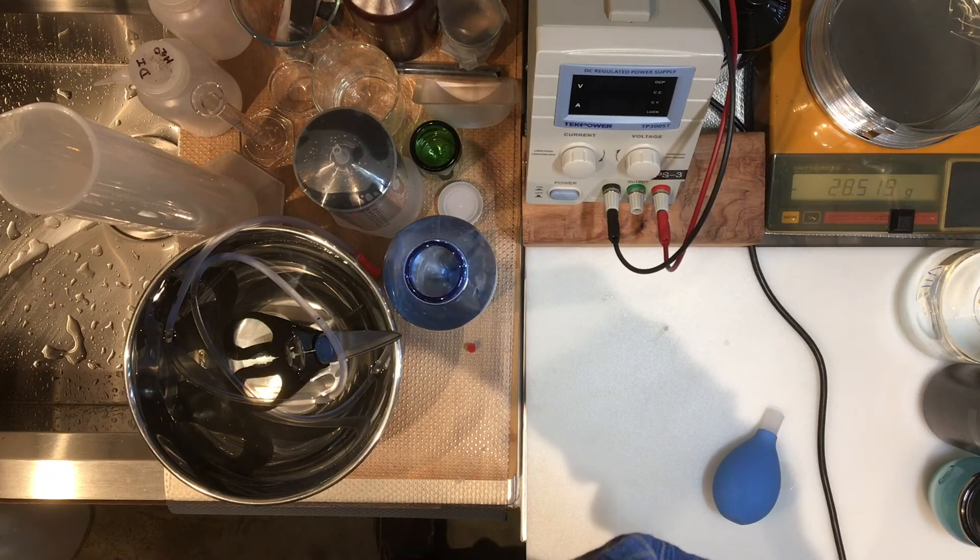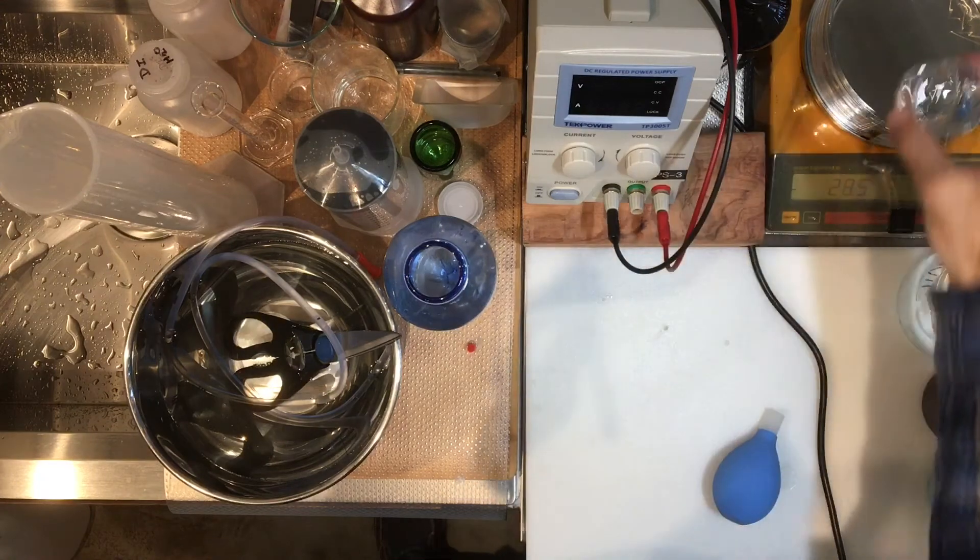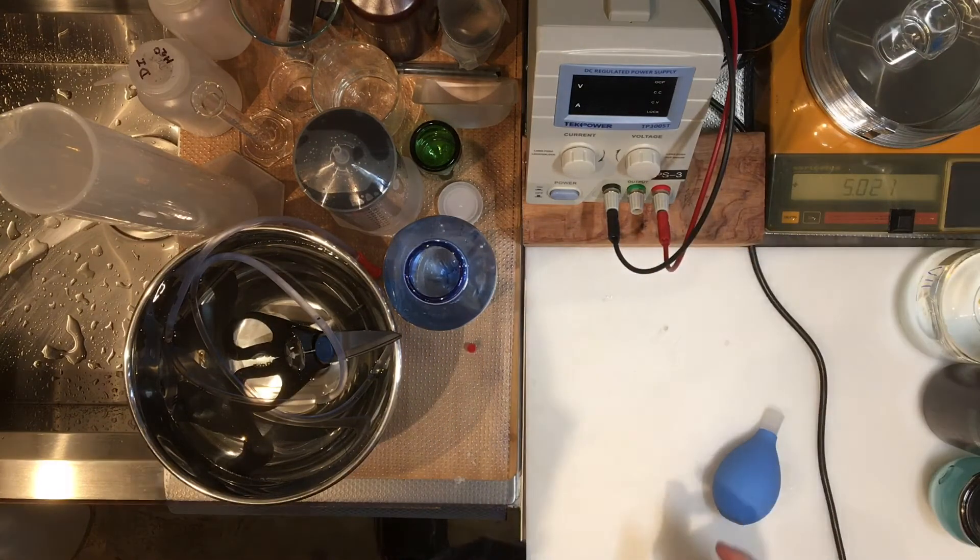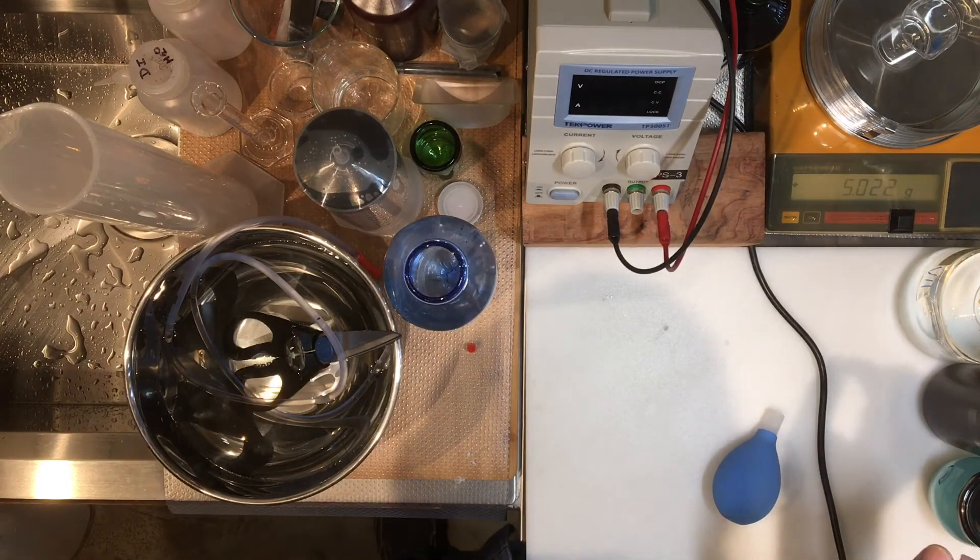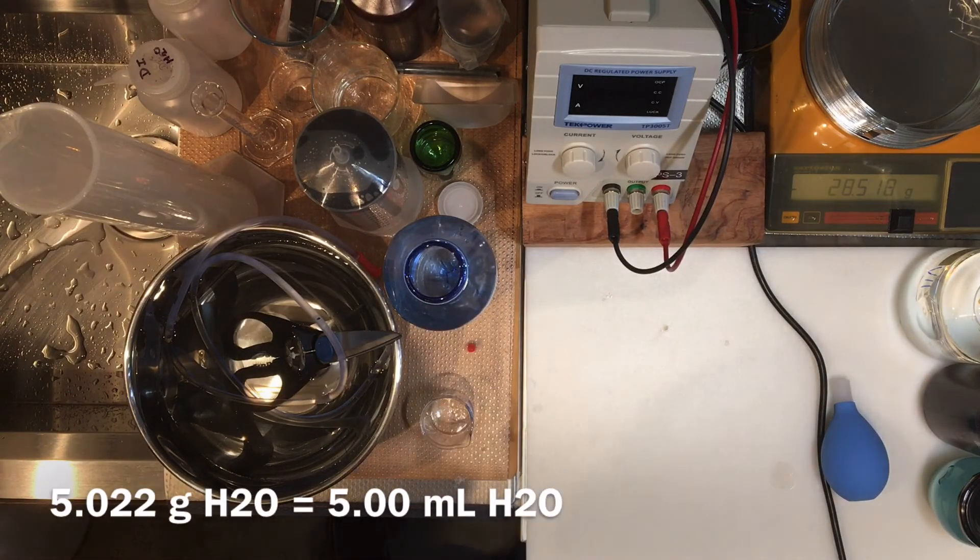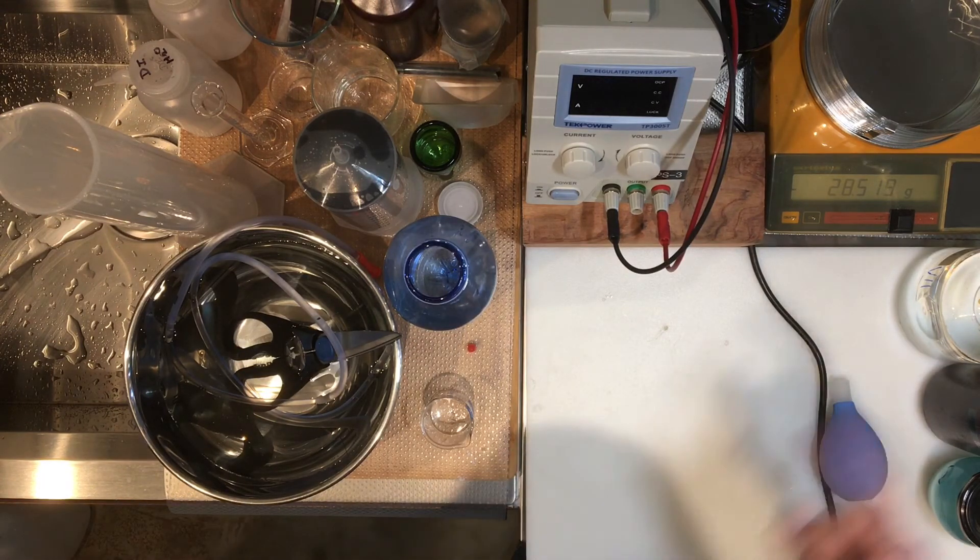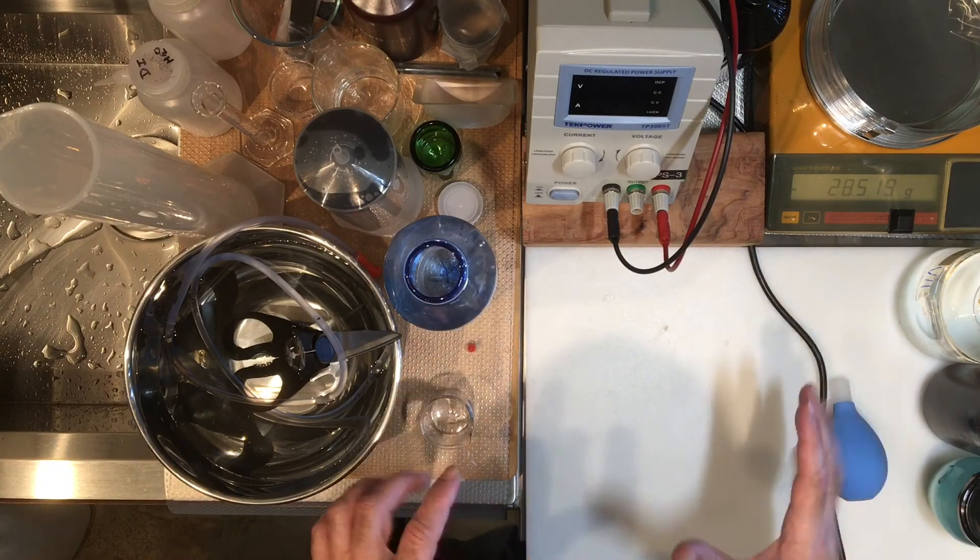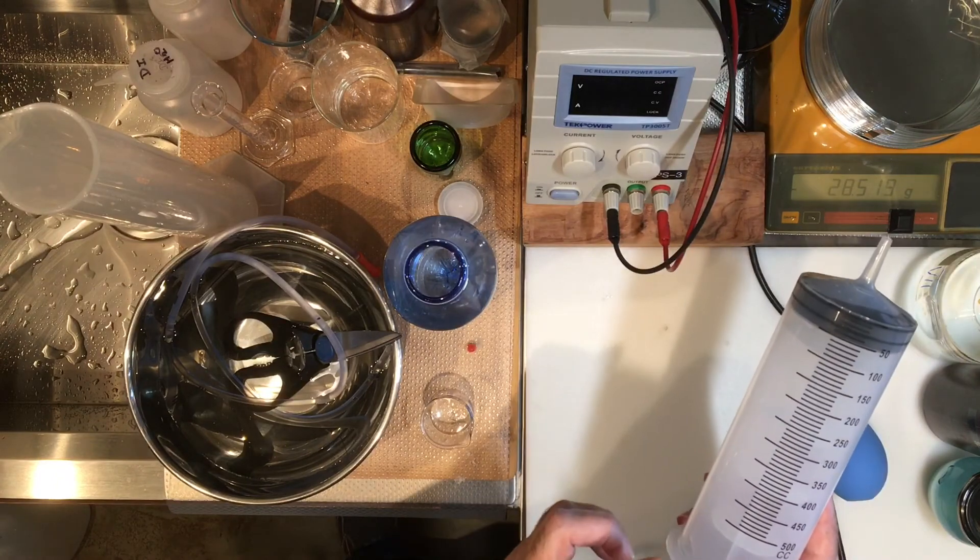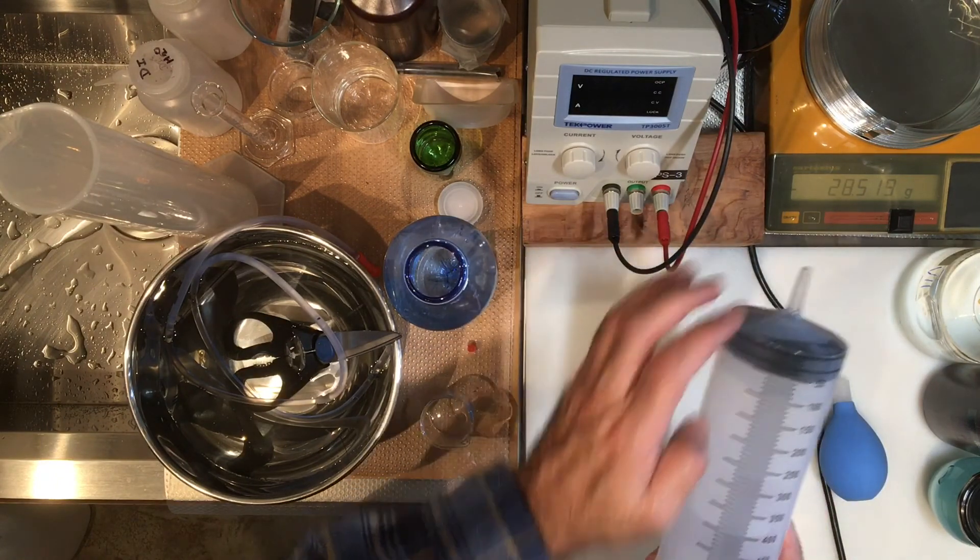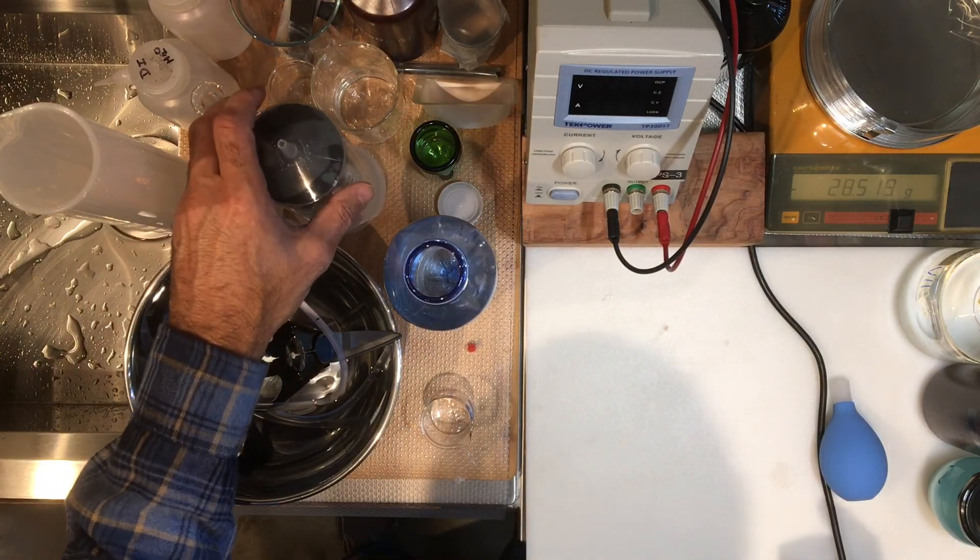I had it set to zero. There it is, so record this mass. This is the mass of 5.00 milliliters of water. After this we are ready to do our measurement of the gases. Now you can get the measurement to calculate your density after watching the video and calculate the volume of this water that I sucked into here. That's how much you can do so far. That's it for now.